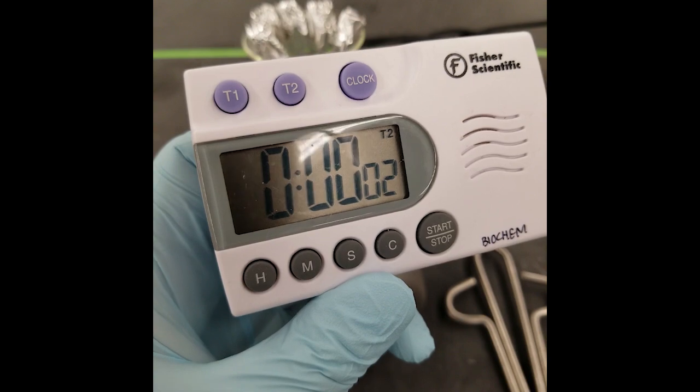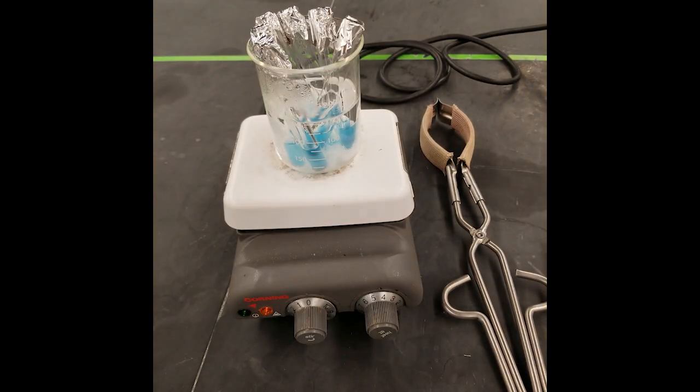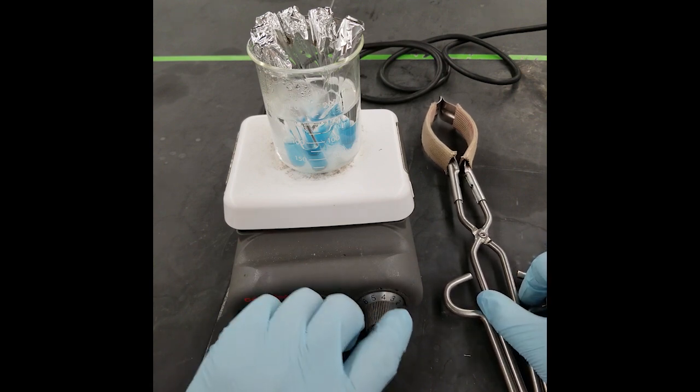At the end of the 20 minutes, turn off the heat to your hot plate and exercise great care to not burn yourself and use the safety tongs to remove your hot beaker from the plate.